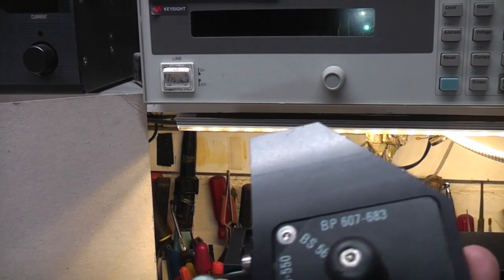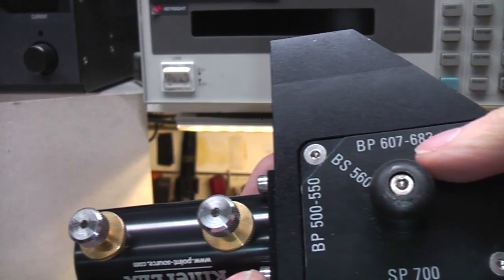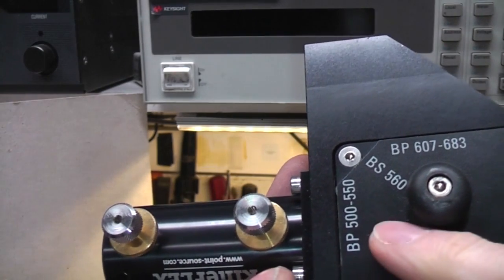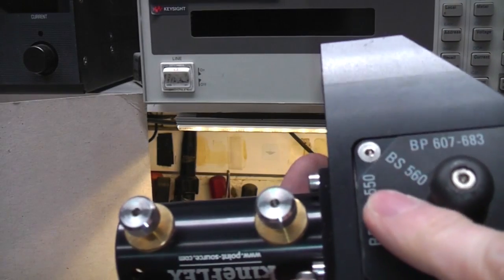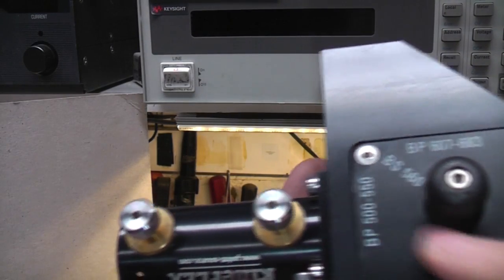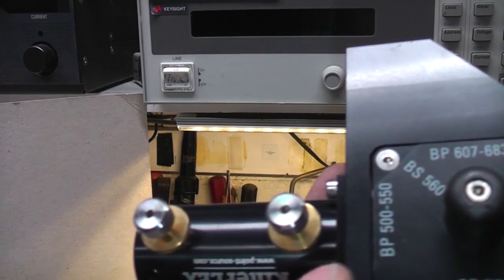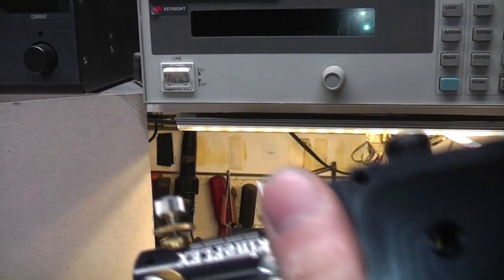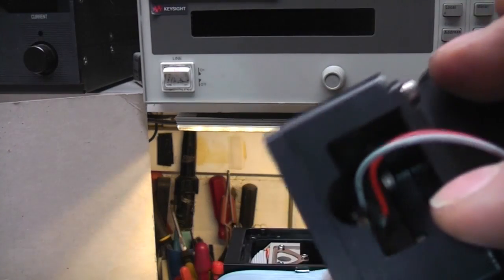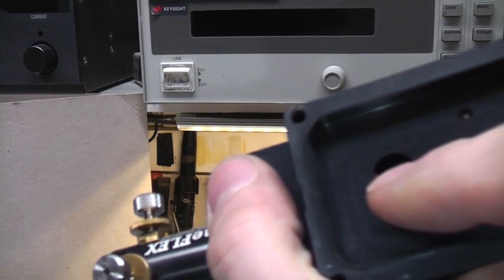And then here in the centre section we can see these are presumably the wavelengths, so I'm getting band pass and I'm not sure, band select perhaps, so 500 to 550 which would be the green, 607 to 683 which would be the red, and then SP700, not quite sure what that's going to be. There's probably some other filters. There's also a shutter in here as well. You can just see the rear of the motor on the shutter, which is sort of partly open.